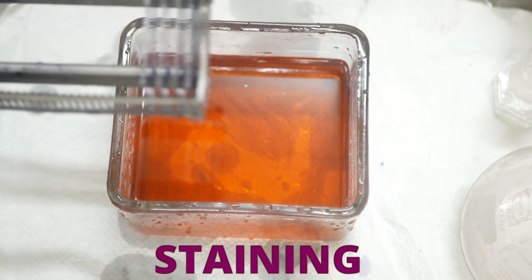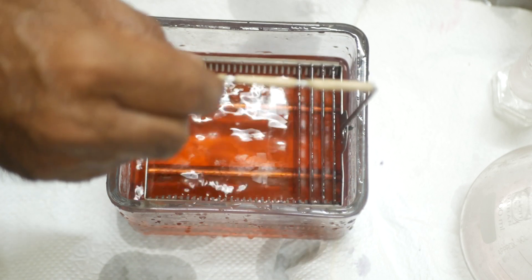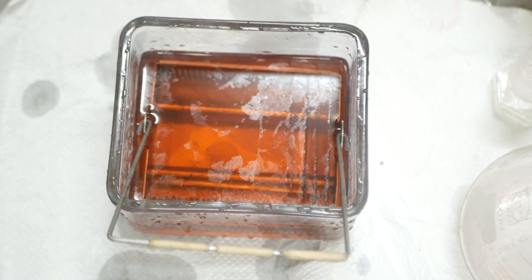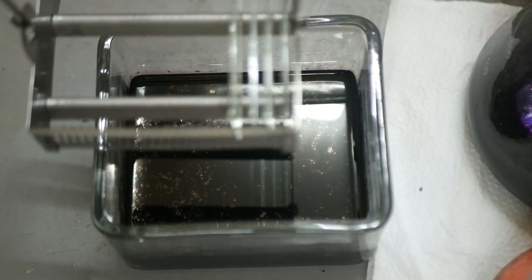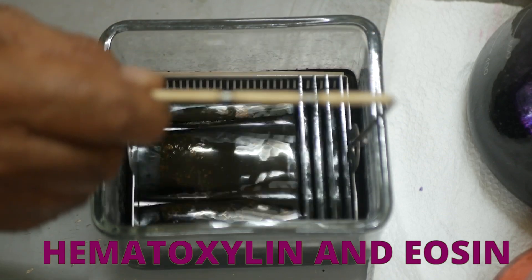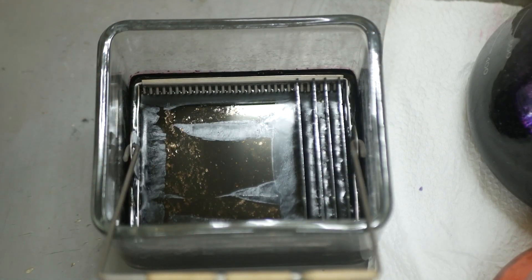The next step will be staining. Histology stains are selected according to the type of tissues examined. This is done to distinguish different biological structures more easily and accurately. Hematoxylin and eosin are some of the most used biological stains, which will also be used for our exercise.